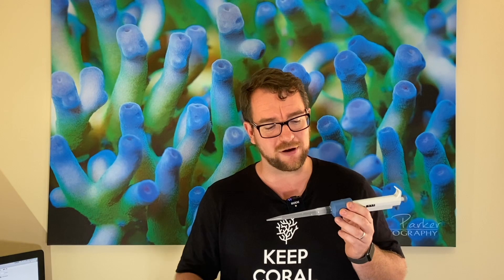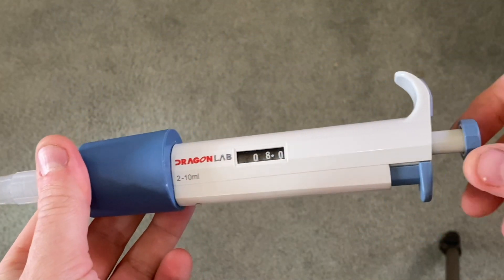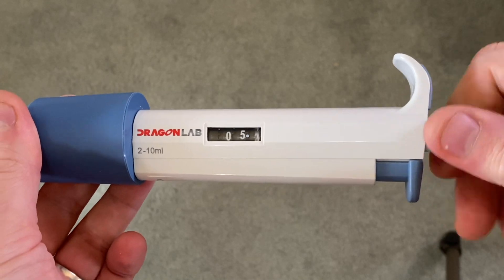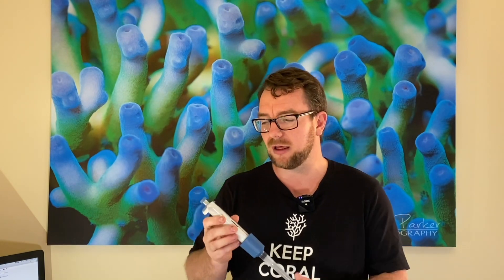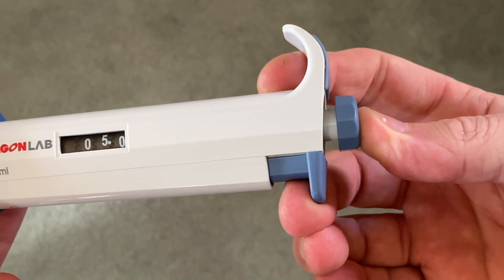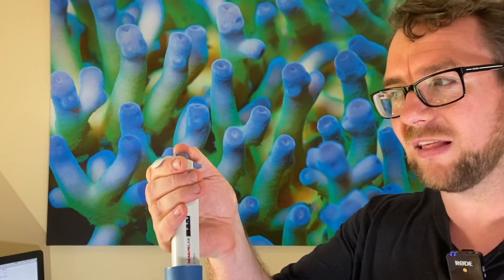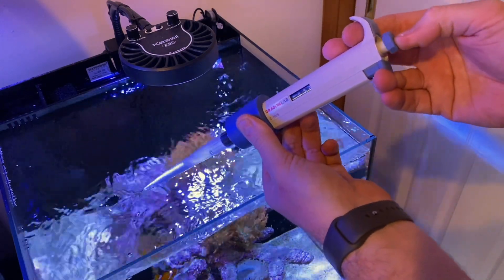These adjustable pipettes are absolute amazing little bits of gear. They're basically a syringe where you can control the amount of travel by adjusting these screws in or out, and they show you on the analog display how much fluid that's going to be. So you dial in — let's say eight mil of water — then you press the pipette down until you feel the first stop. You can press past that. For collection of the fluid, you press down to the first stop, put it into your liquid, release the button to draw the fluid up into the syringe, then go over to wherever you want to expel the liquid and press it all the way down.